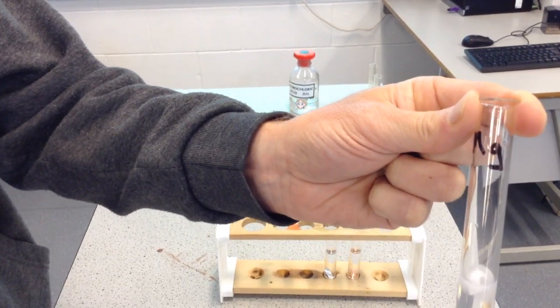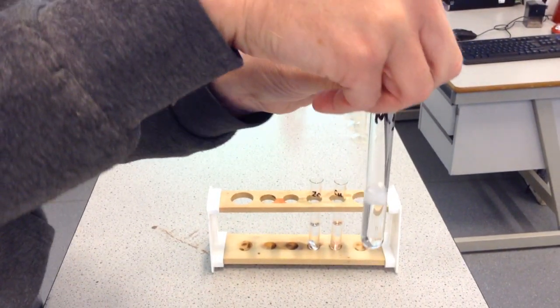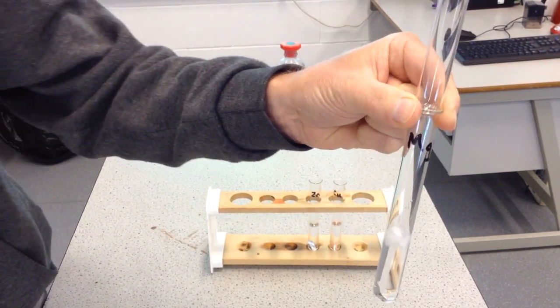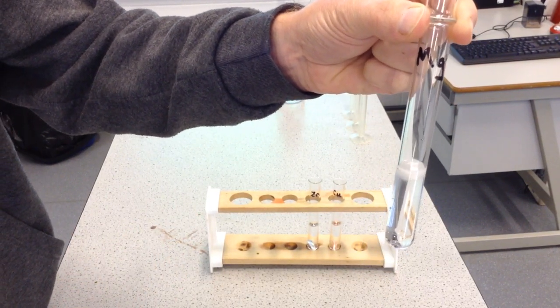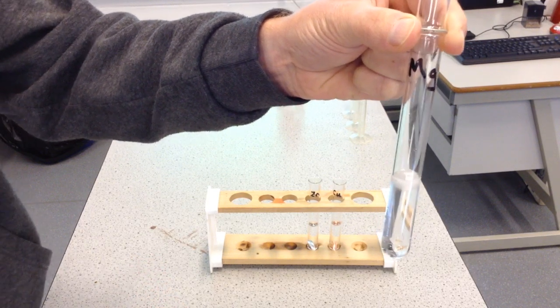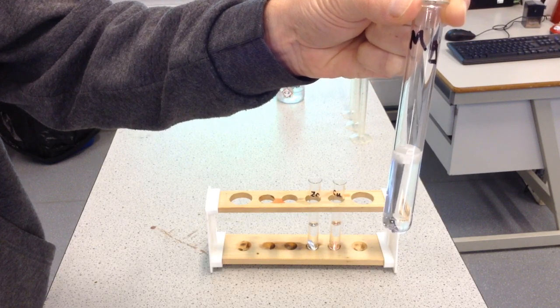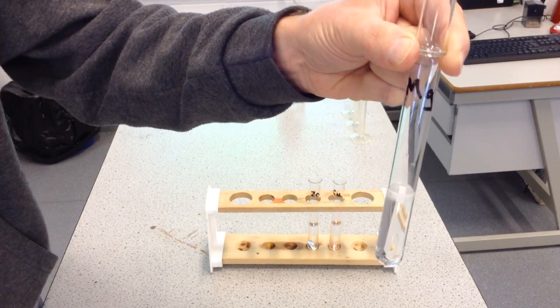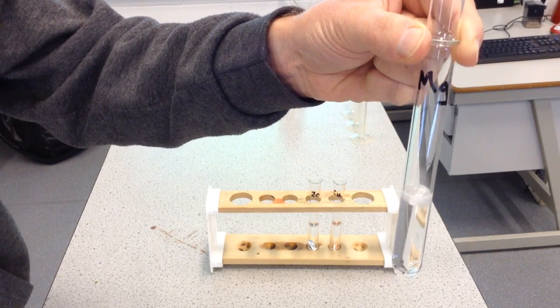And what I'm going to try to do is collect some of this gas. Now, before I do this test, I will warn you, it's a bit unreliable. Sometimes it works and sometimes it doesn't. We had a practice go just now and it didn't work, so we'll see. But this reaction between magnesium and hydrochloric acid is releasing a gas, and maybe you'll be thinking about what gas that might be. The clue could be in possibly the name hydrochloric acid. And maybe, if you are thinking about what that gas could be, this will be the clue, because in a moment I'm going to test it using a burning splint.